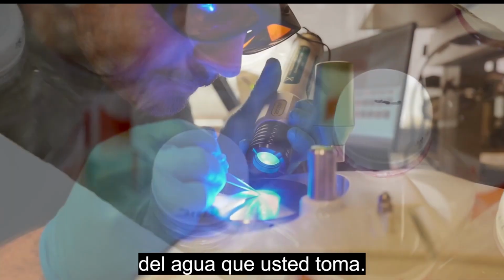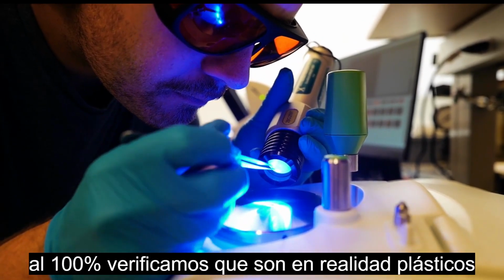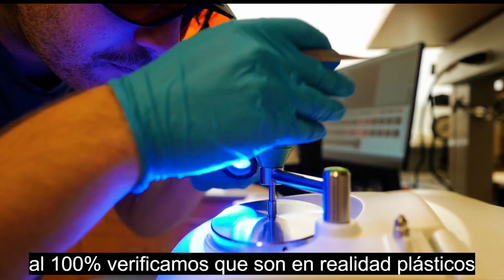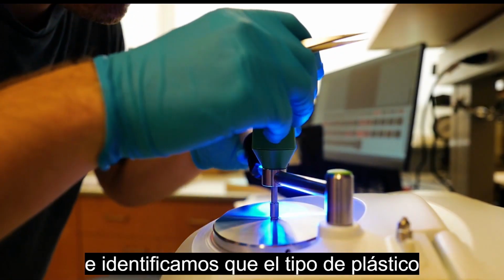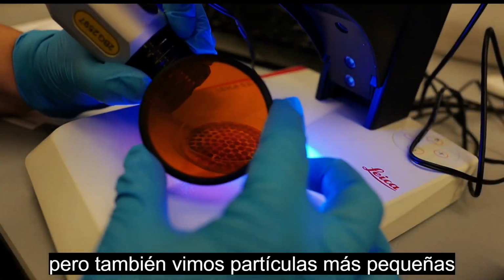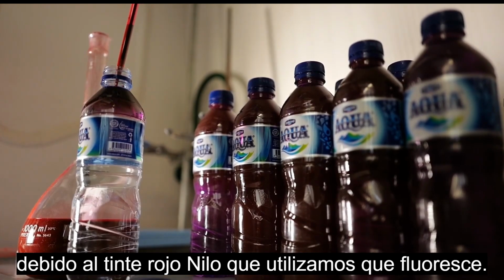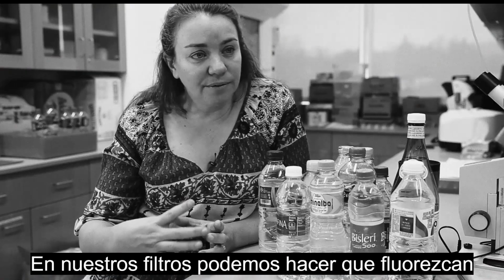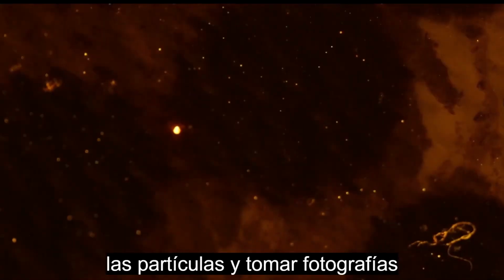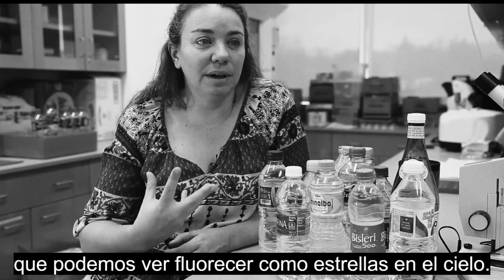The particles that we were able to analyze to 100% verify that they are in fact plastics and identify the type of plastics are probably on the order of 100 microns and larger. But we can see particles that are smaller than that because of the Nile red dye that we used that fluoresces. And so on our filters then we can fluoresce those particles and take photographs and analyze the number of particles that we can see fluorescing like stars.